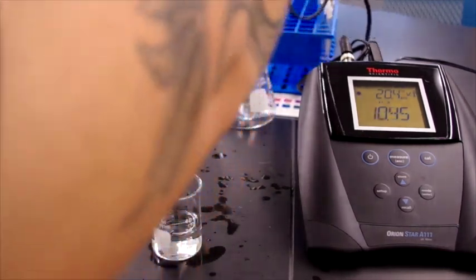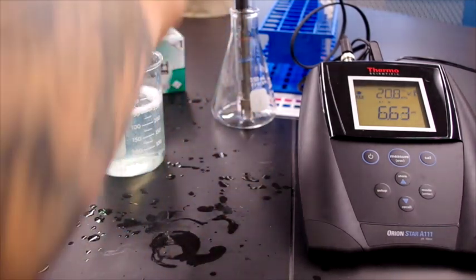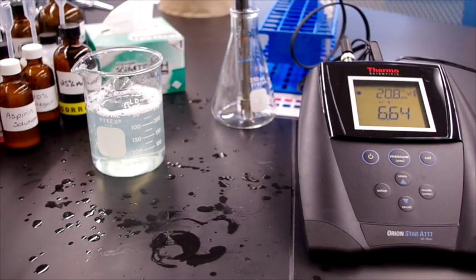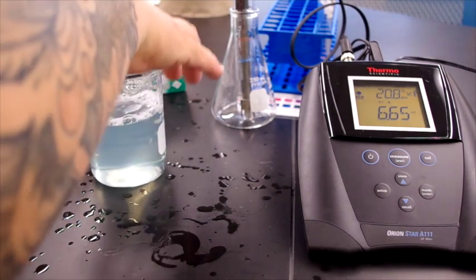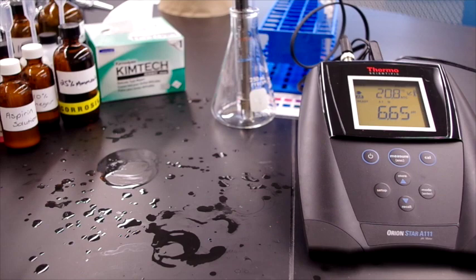And we store our pH electrode as we found it in a sample of water. Dispose our waste into this jar. And since all of these are over-the-counter, commonly available substances that are considered to be reasonably environmentally friendly, we can take all of this and pour it into the drain. So that is part B of the acids, bases, pH, and buffers lab.